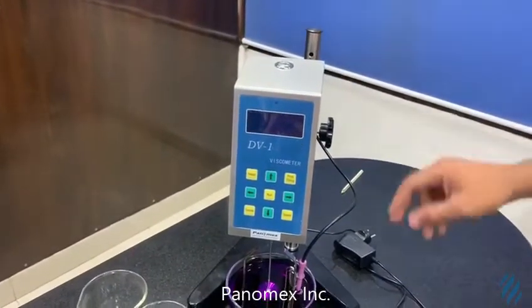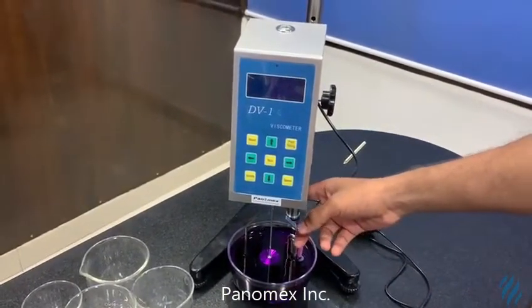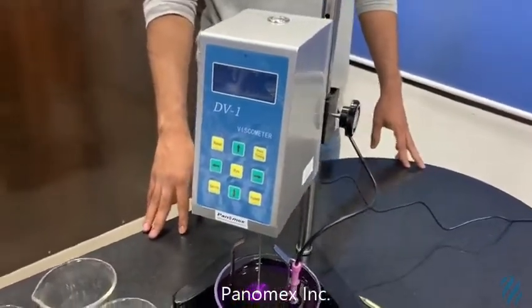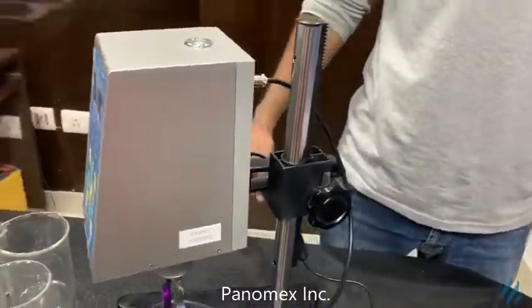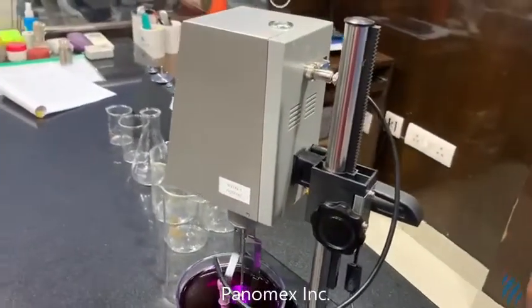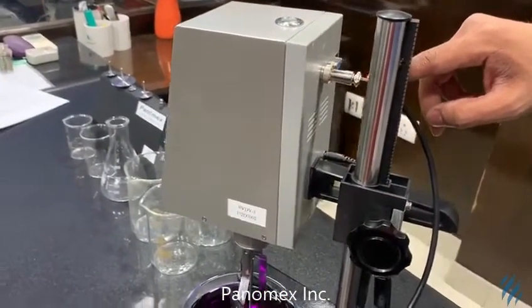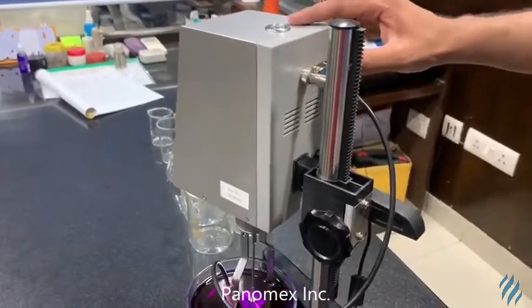This is the main machine. This is the pole, this is the base, the protecting sleeve, and the rotating shaft. This is for the temperature sensor — your temperature will be sensed through these.